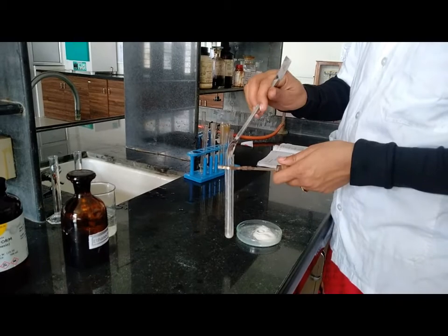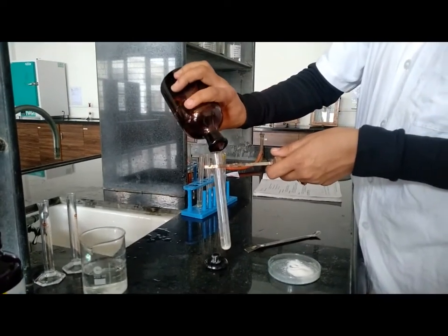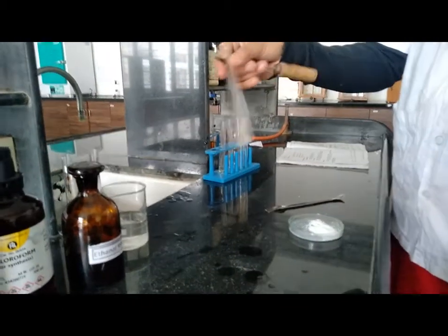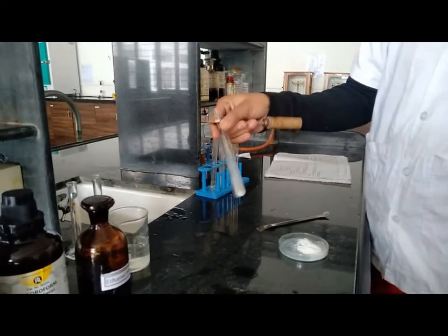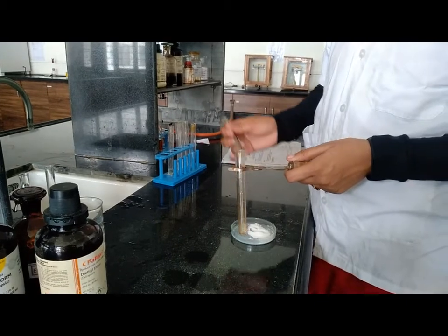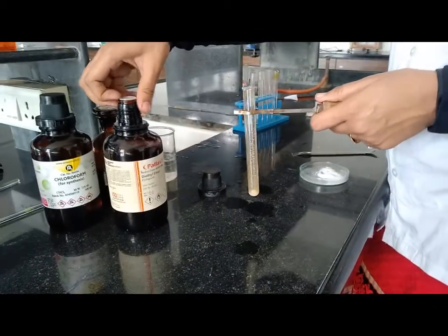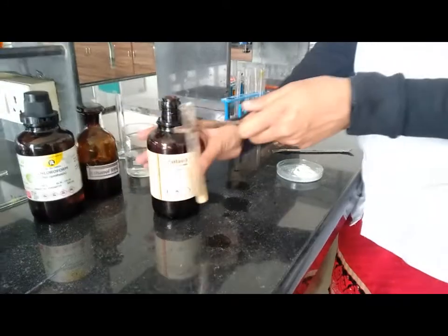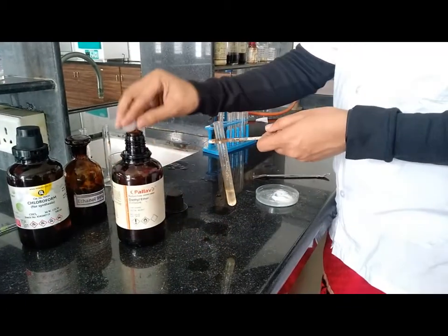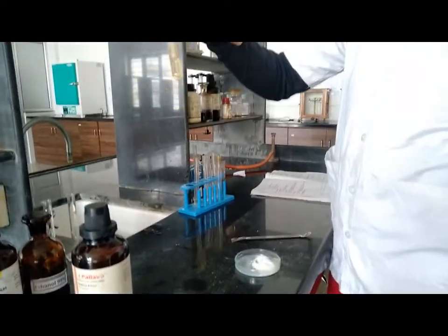Now check the solubility in ethanol. Shake it properly — promethazine hydrochloride is freely soluble in ethanol. Now perform the solubility test in ether: take the sample, add ether as solvent, and check whether it is soluble or insoluble. In ether it is practically insoluble.